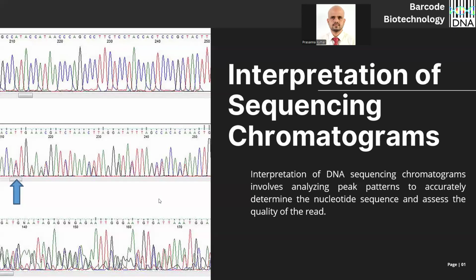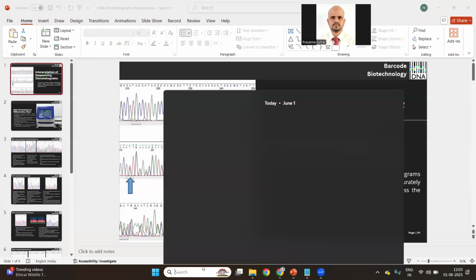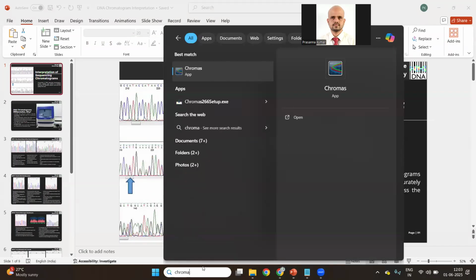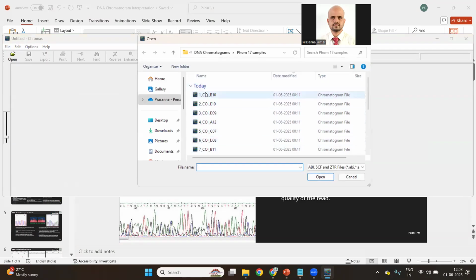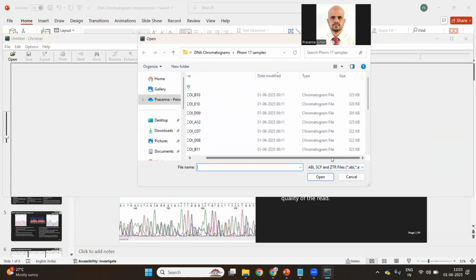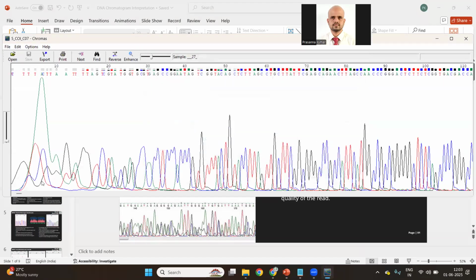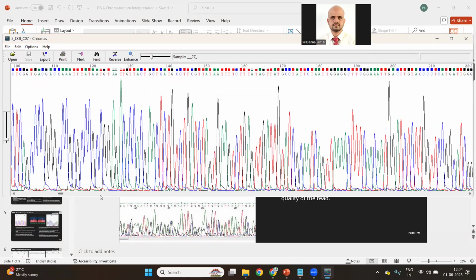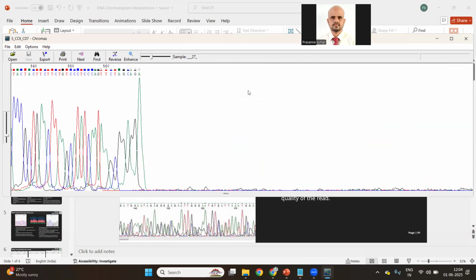Before that, I want to introduce a new software today for you guys. This software is Chromas Pro, or Chromas, you can call it. Chromas is actually a DNA chromatogram reading software. These are the chromatogram files, these are ABI files. These are actually machine output files. Once I load them in Chromas, this is how the machine output file will resemble. Here I have trimmed out the low-quality noisy regions. I will tell you more.